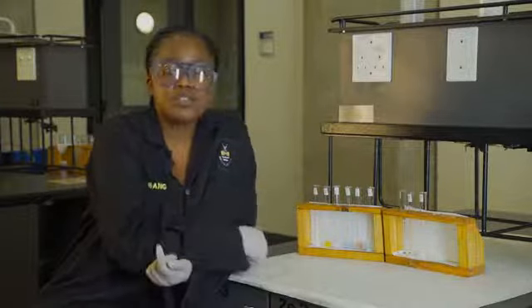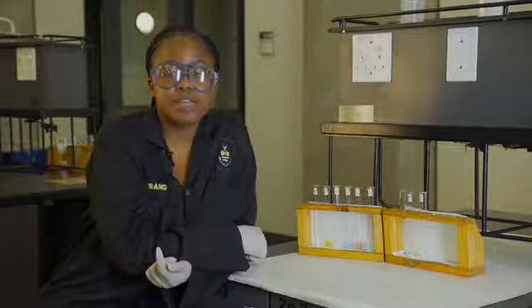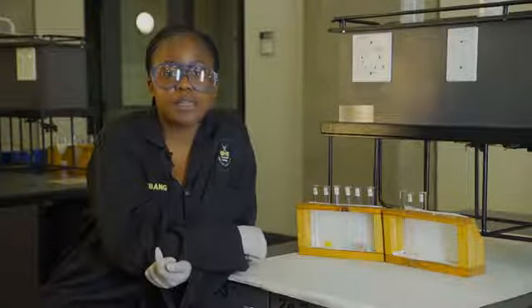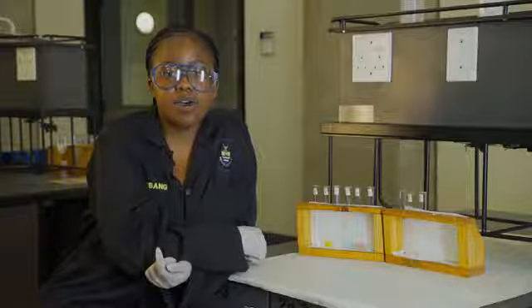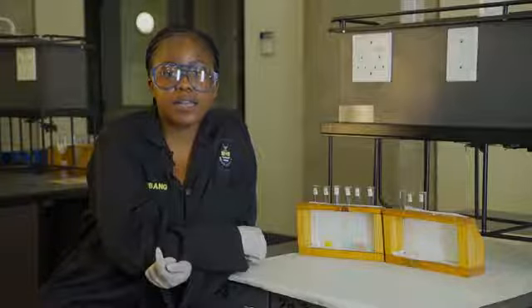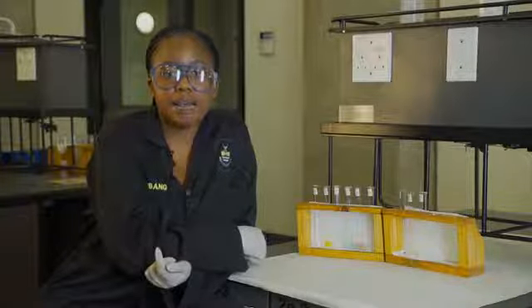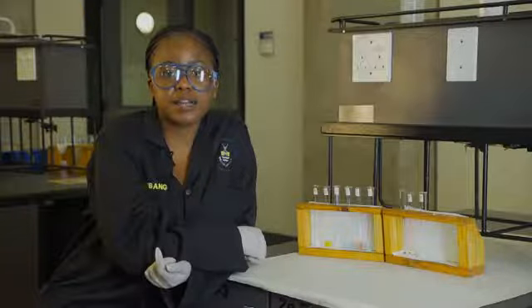These contain salt solutions with cations that have been pre-identified to be aluminum, iron, copper, nickel, cobalt, ammonium, manganese, and silver.